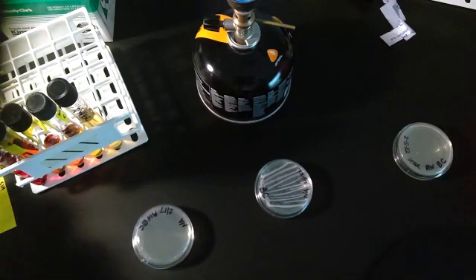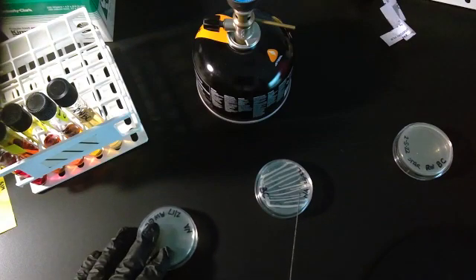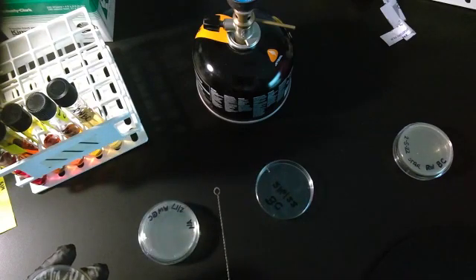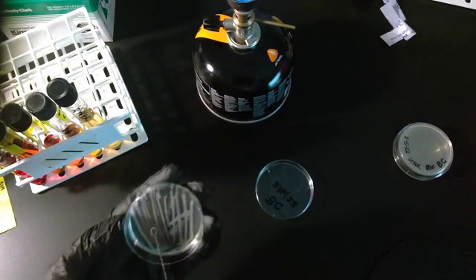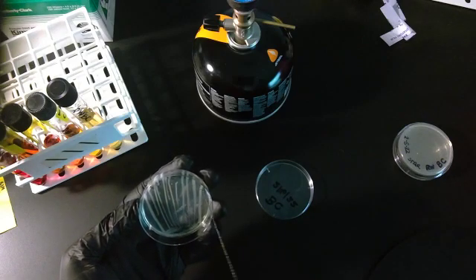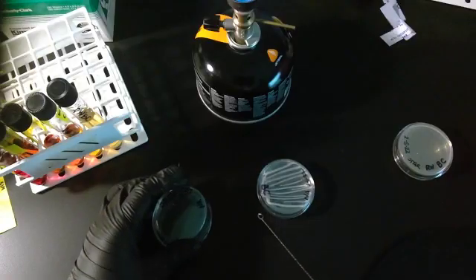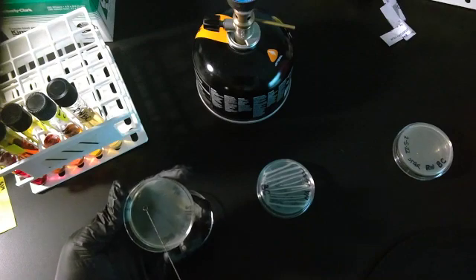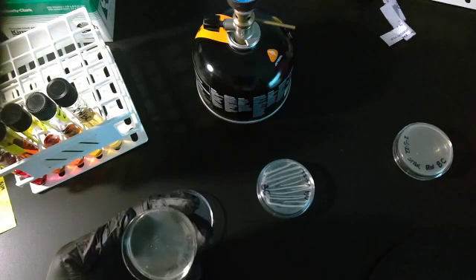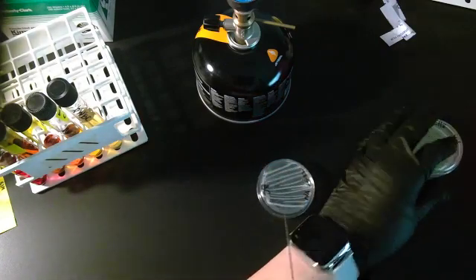The next plate is the nutrient agar, the one that I'm going to do the catalase test with. So again, I've already sterilized this second loop. I'm going to grab a little bit of bacteria on my loop. Again, you can see the little lump. Flip my nutrient agar around and spread this on my nutrient agar. Doesn't have to be neat, it doesn't have to be clean. I'm done with that plate.